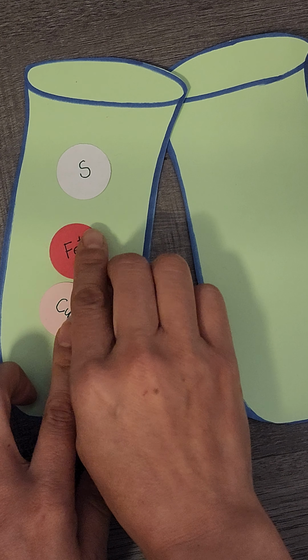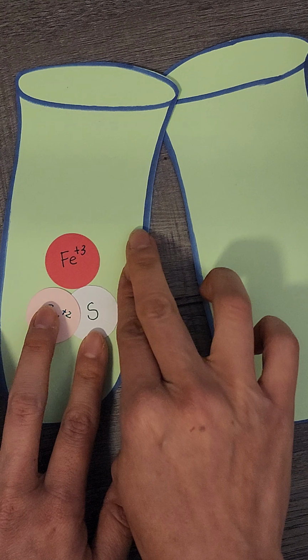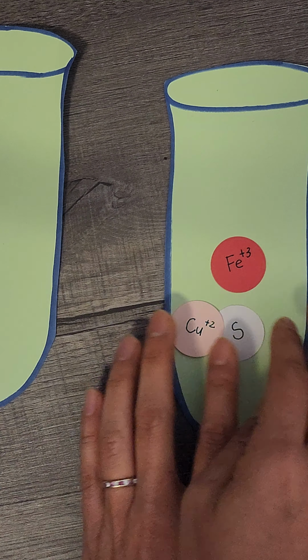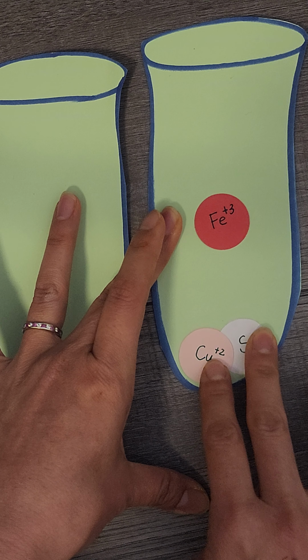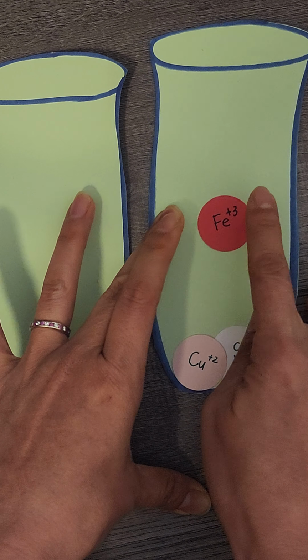By this time, hopefully the copper and the sulfur from the thioacetamide have reacted, and you see some murkiness in the liquid. You're going to spin this, causing the precipitate, which is now the copper sulfide, to sink to the bottom, and you have iron still floating around.